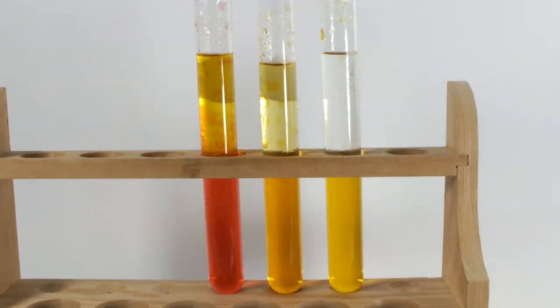In the acid tube, there's actually quite a lot of dye extracted to the organic layer, but notice it's not red. The acidic environment doesn't migrate to the petroleum ether, only the dye does, so it remains a very strong yellow color.